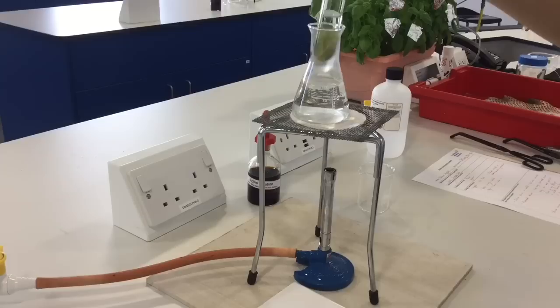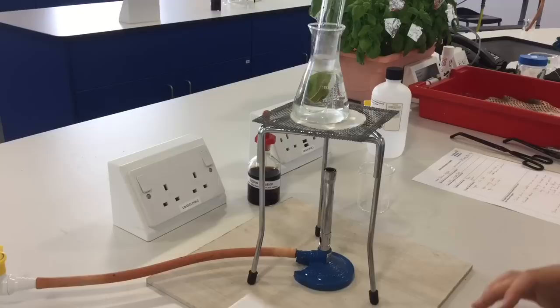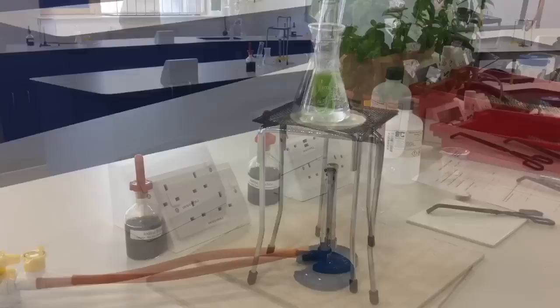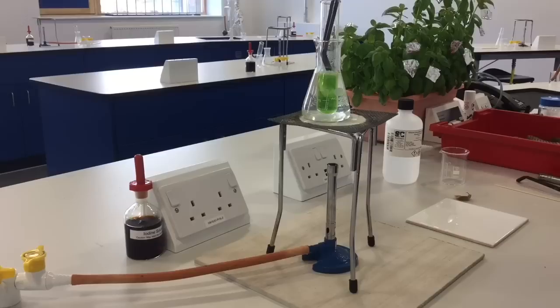Then you can put that straight into the conical flask or beaker that you were using earlier. Once that's all set up, we'll light our Bunsen burner and it's going to start to decolorize the leaf. The leaf color, the pigment—the chlorophyll—is going to come out of the leaf and go straight into the ethanol.